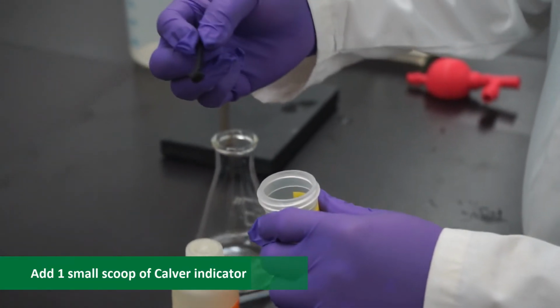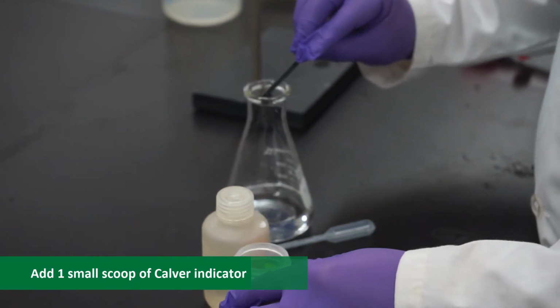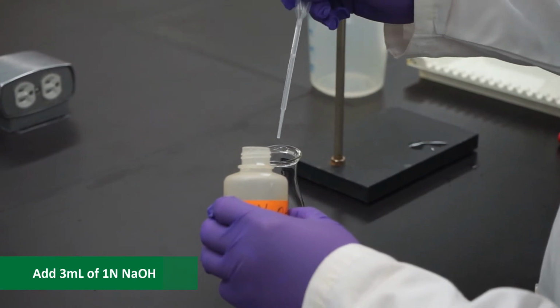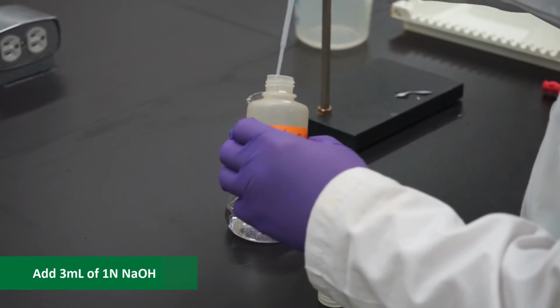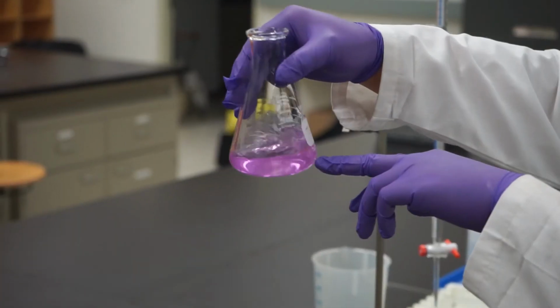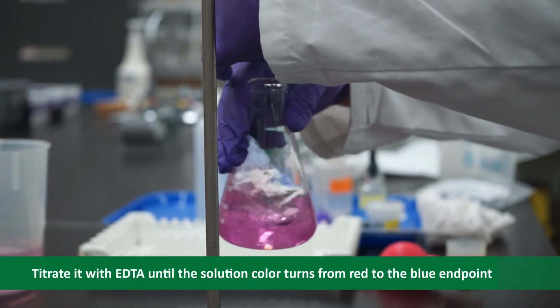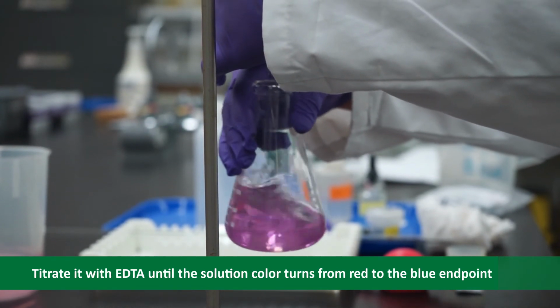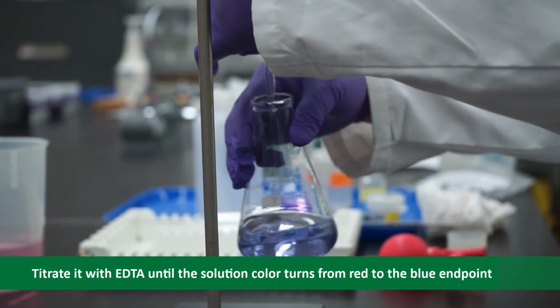For calcium hardness, add 1 small scoop of Calver indicator and add 3 ml of 1N NaOH and shake it. The solution will turn red. Titrate it with EDTA until the solution color turns from red to the blue endpoint. Write down the final EDTA volume.